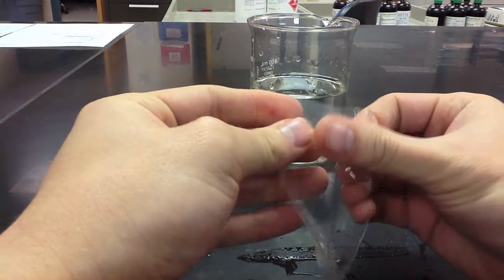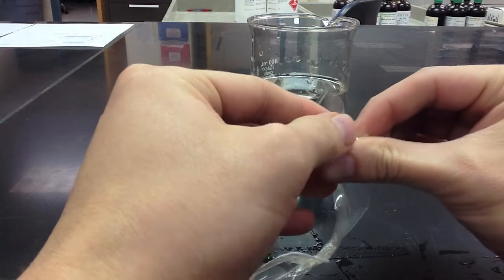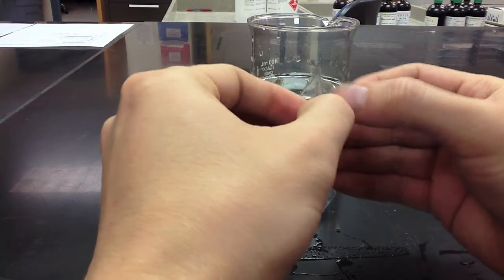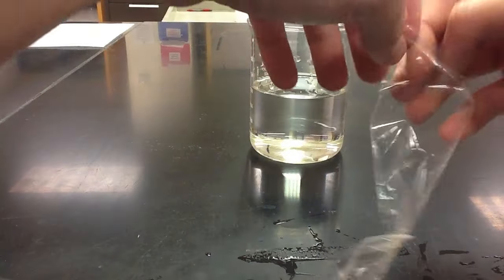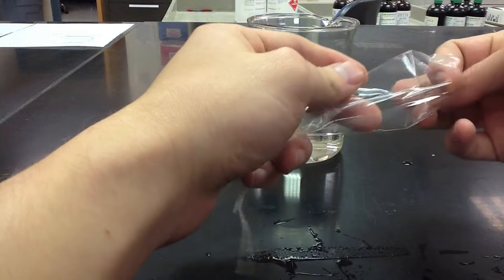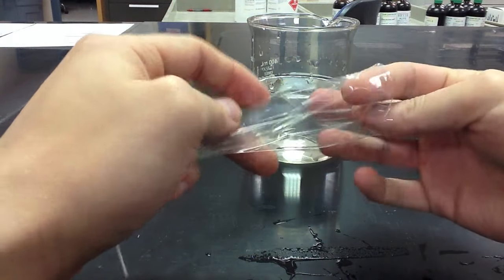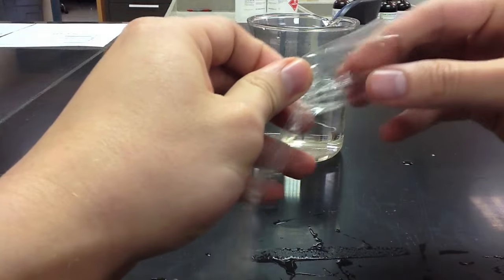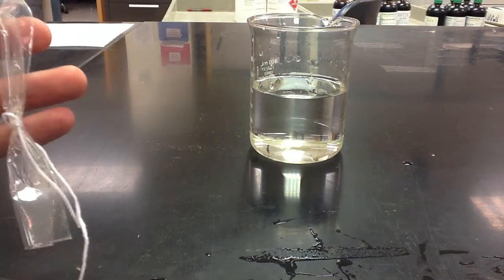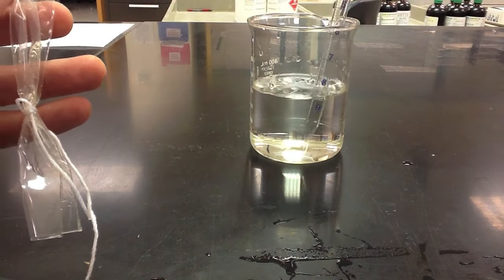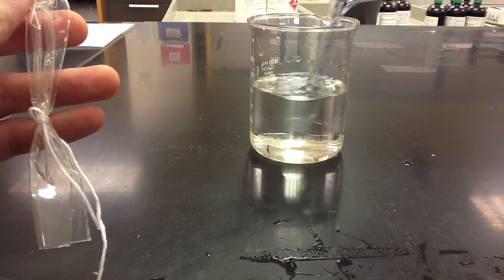If this is the first part of the lab where you're adding either a sucrose or water solution, you'll simply pry the bag open on the opposite end, make a little bit of space so that the pipette's nose can actually dip into the bag. Then you'll take your pipette and fill it with whatever solution you want to add. In this particular instance I'm using water.